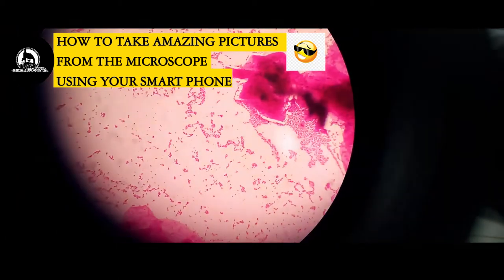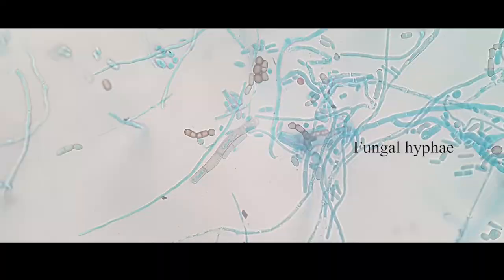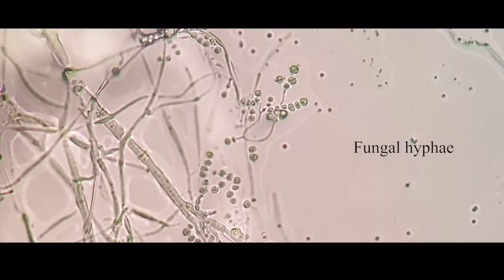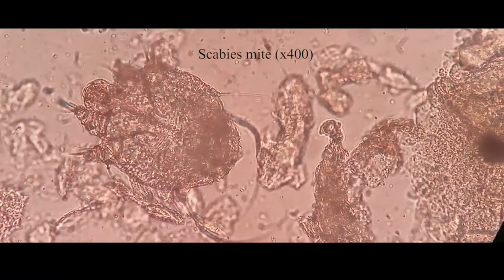In the world of microbiology, it's always good to prove a point with pictures. And so today, we shall be showing you how to take good pictures of the things you see under the microscope with your smartphones.